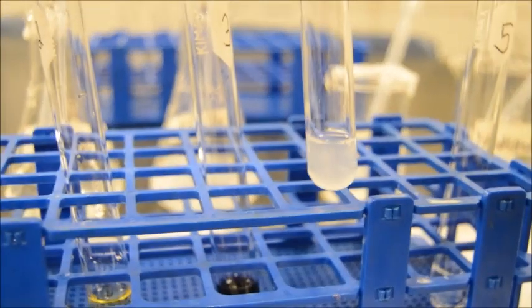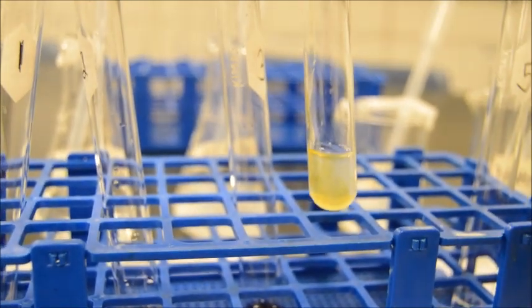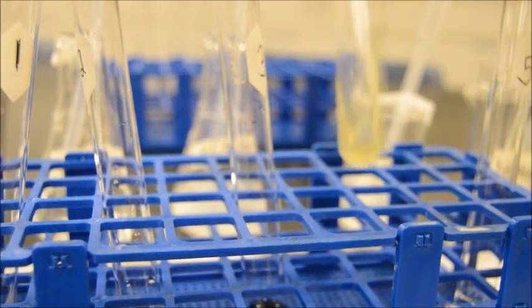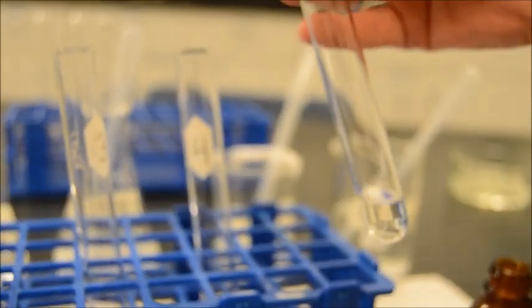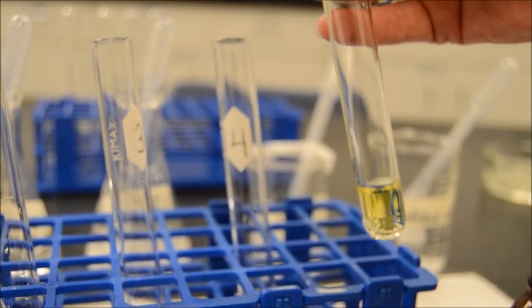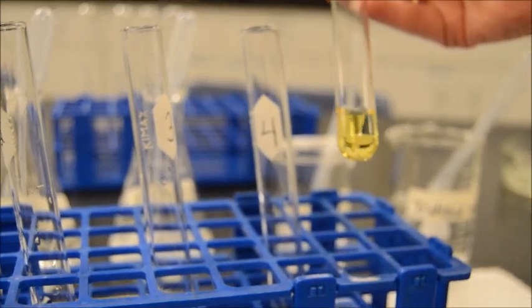Yes, indeed. So our next one is albumin, which is in essence egg white, and it stays a nice tea color. One of the good things about an iodine reaction is it's very obvious. There's your 10 drops, giving that tea color, not unlike these over here. And last but not least, we have distilled water, which is our negative control. Nothing is happening. There you go. That is a nice set of starch reactions.